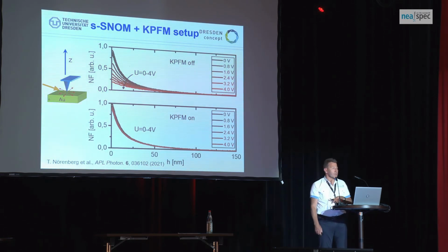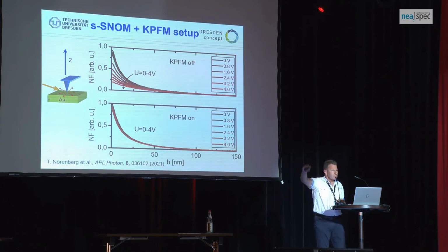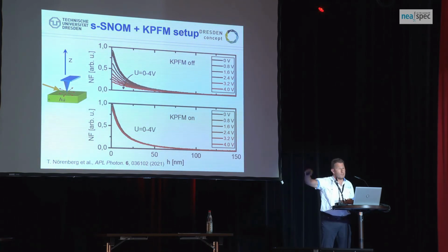Well, not knowing what voltage you apply to your cantilever, you could get any of these curves, and you see nicely by now putting them together in the same manner that already at 1.6 volts, which is typically the surface potential difference, you get a reduction of your near field amplitude by 50%. What it means is simply that your electrostatic force is damping down your cantilever, which means in the end it's not as freely oscillating, but gets broader in its Q value.